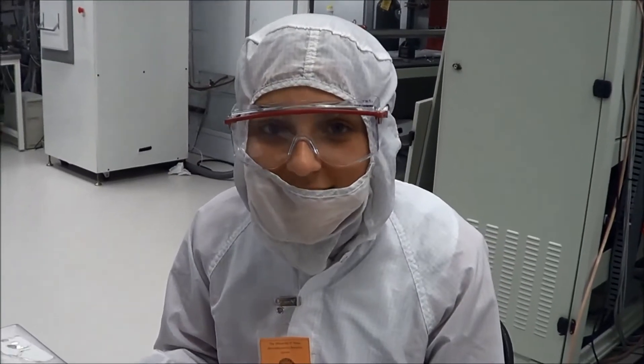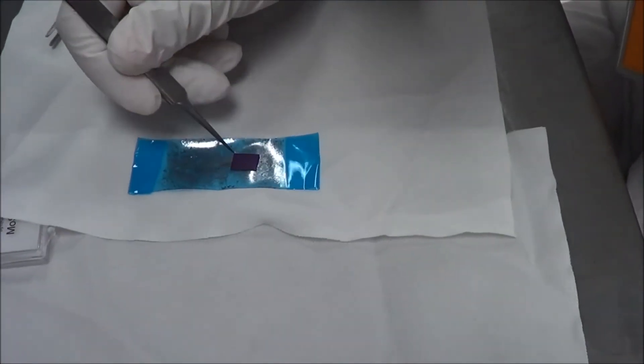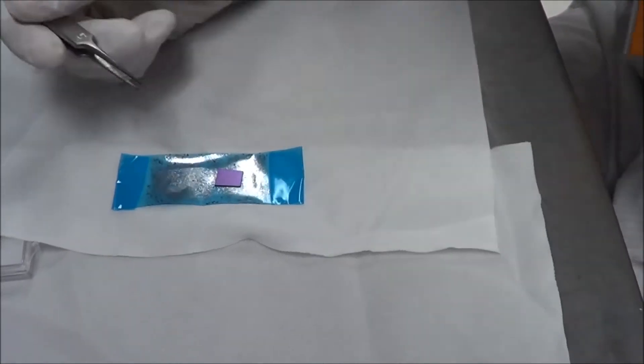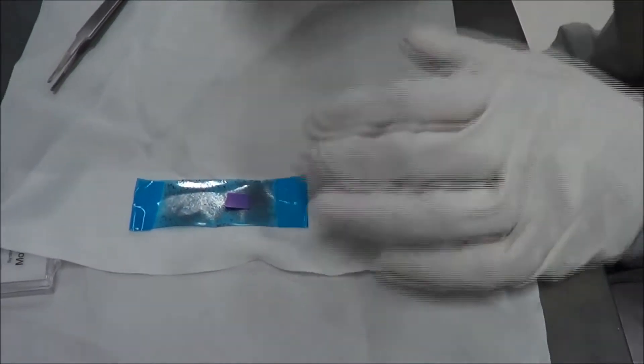I have now placed my silicon-silicon oxide wafer onto the blue tape. I will now tap each of the four corners to ensure that my flakes adhere to the wafer. Then I will remove it.